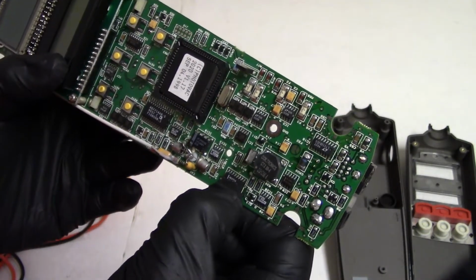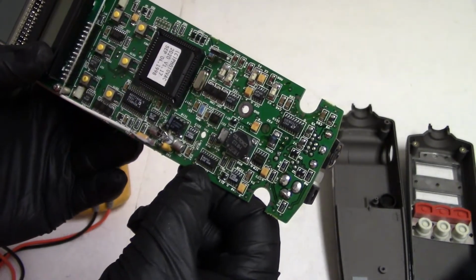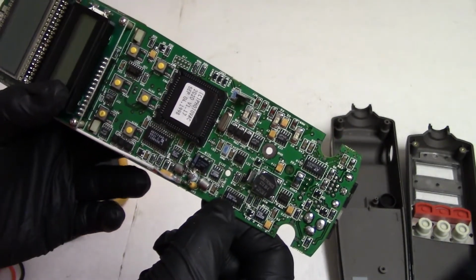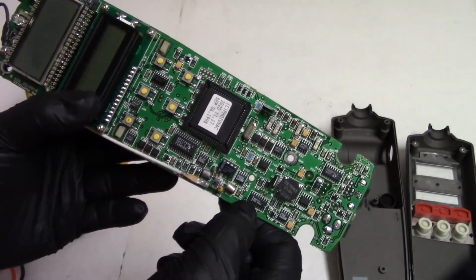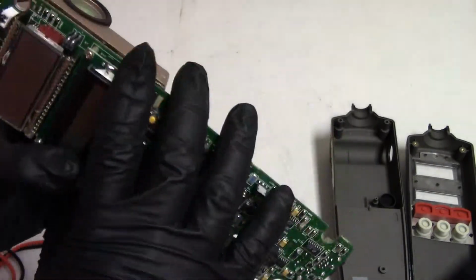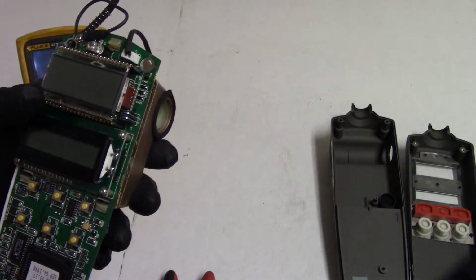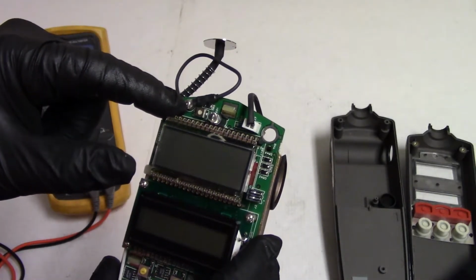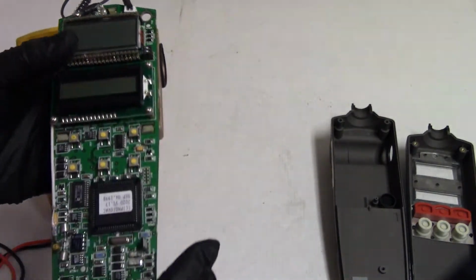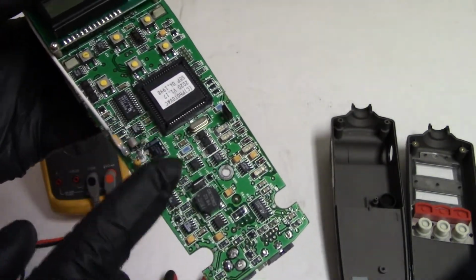Max 713. So that's some sort of communication. So there's probably some analog to digital converters in here. This is clearly power stuff. And then I'm sure there's things for controlling the motors and the lights and stuff. I don't know if that pot there is for adjusting the high voltage or what. Just don't know. I suspect the high voltage is being made by these two transistors, though.